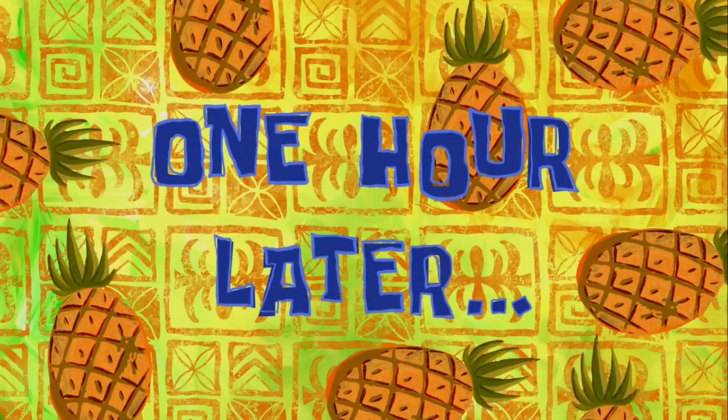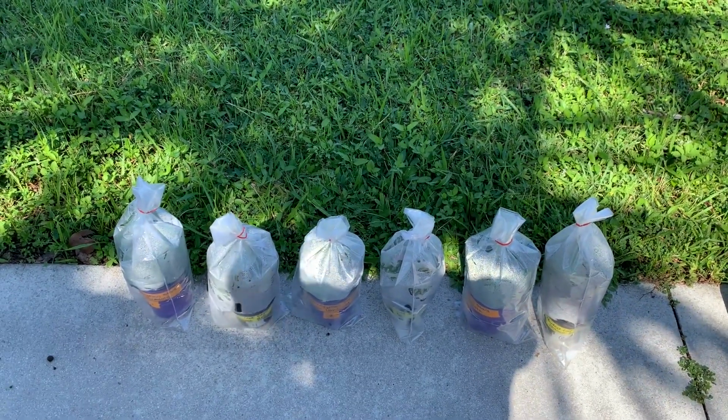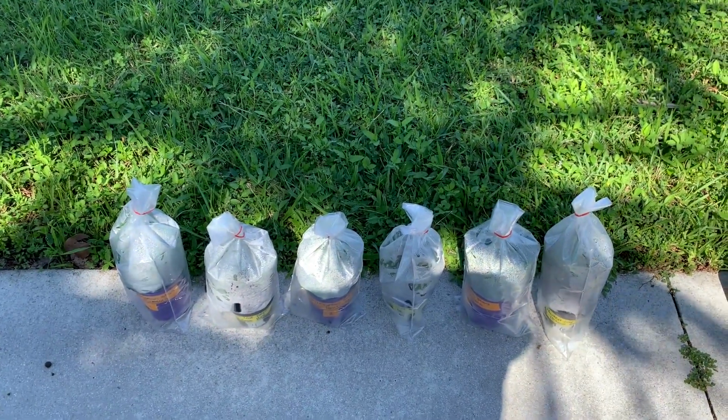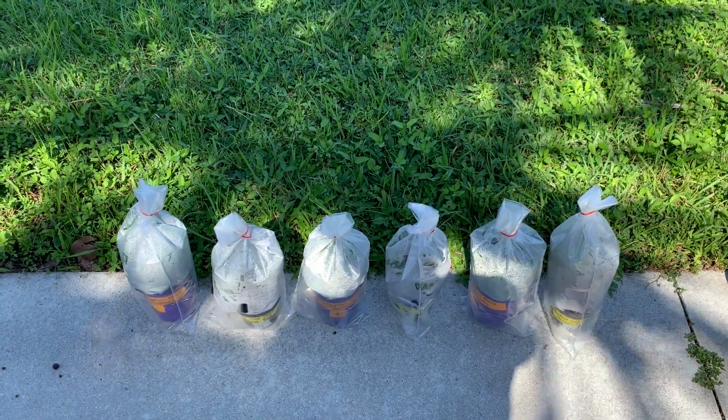1 hour later. Okay, it's now been an hour, so I'm going to take the plants out of the bags and weigh each one. To make it easier for me, I'm not going to film this process, but I will take a picture so we can have that to look at.